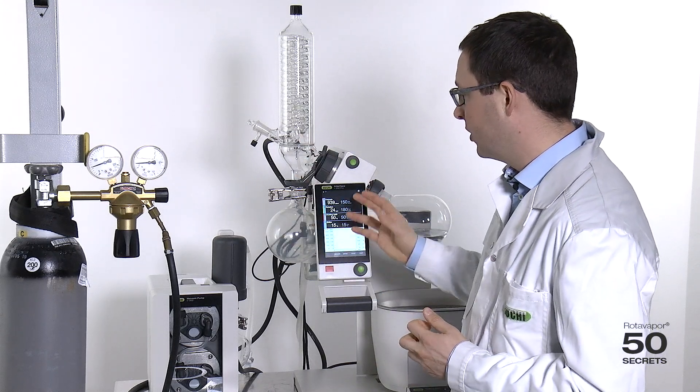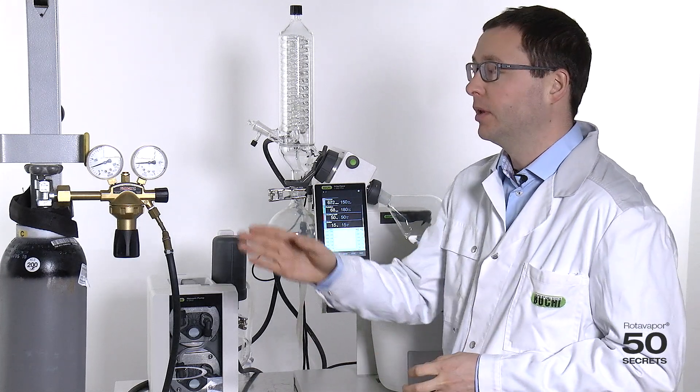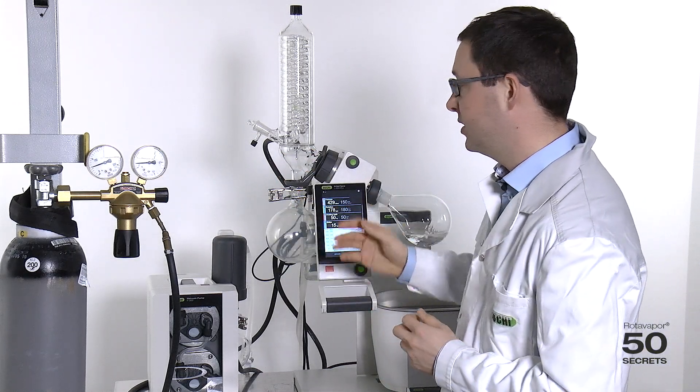The vacuum pump will now start to get to this vacuum. Once we have reached the vacuum, we will open the valve in order to flush or purge the system with nitrogen.